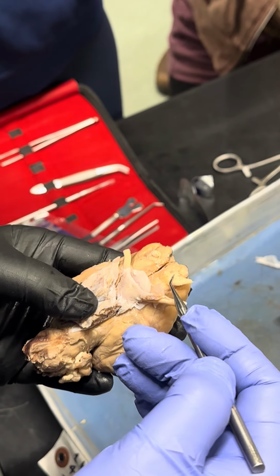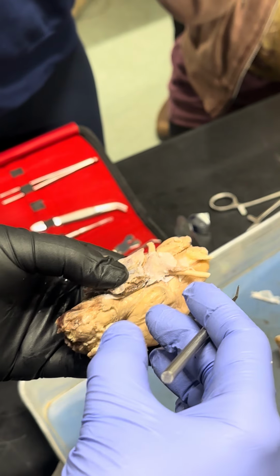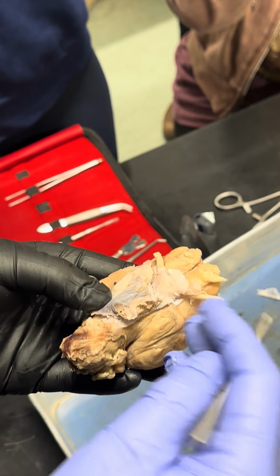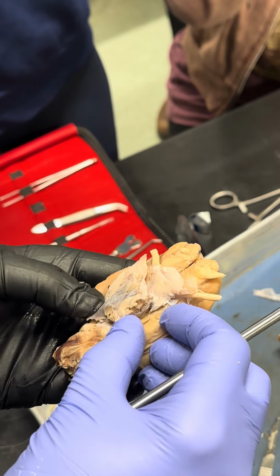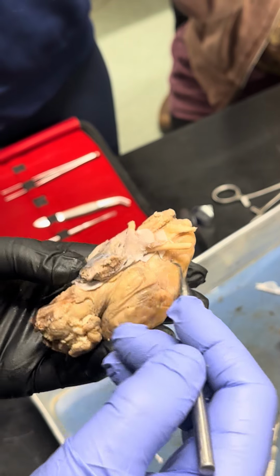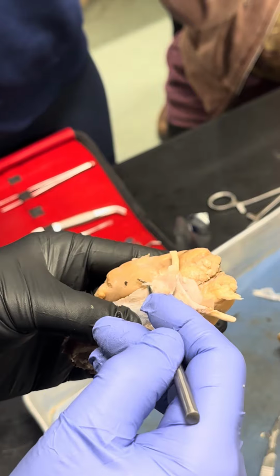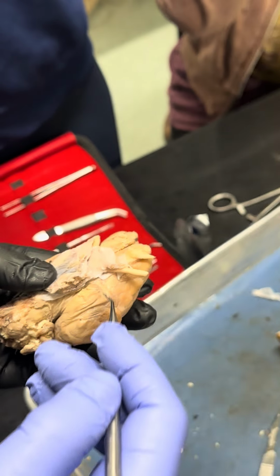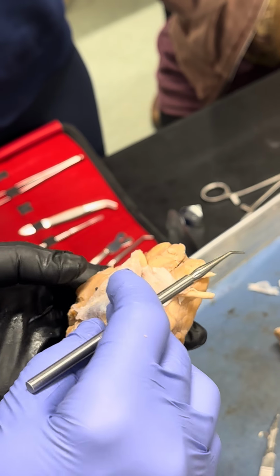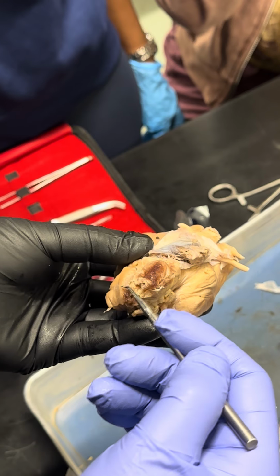This olfactory nerve and optic nerve come directly from the brain, actually. Okay, and other nerves are coming from the brain stem. So you have here these two nerves. See this one, and this one. This one is the oculomotor nerve. Okay, this one is cerebellum, and the spinal cord is already dissected here.